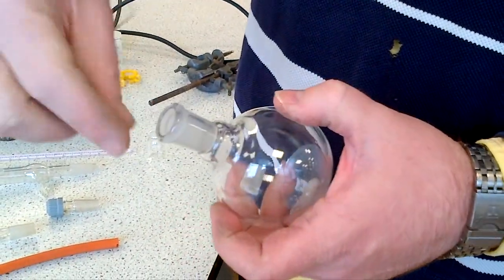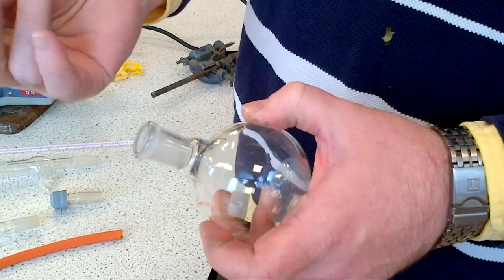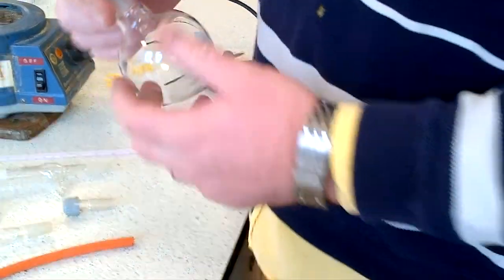If it's dirty, use tissue paper to clean the outside, or cotton wool with acetone to clean the neck of the flask. Presume there's an organic liquid inside.